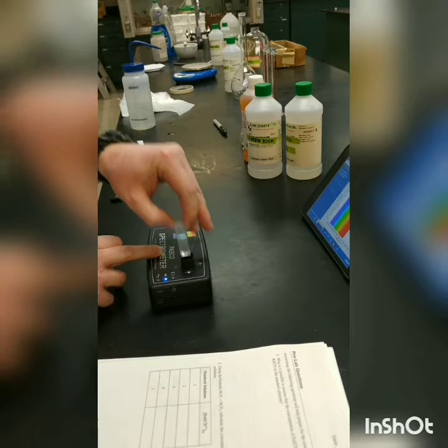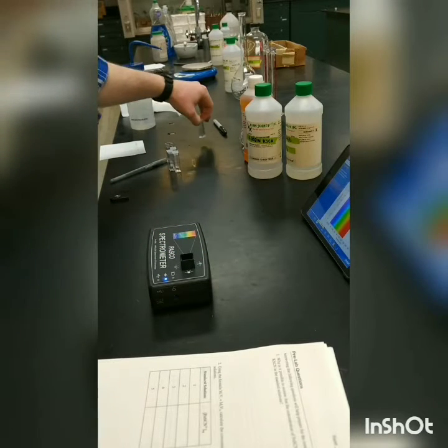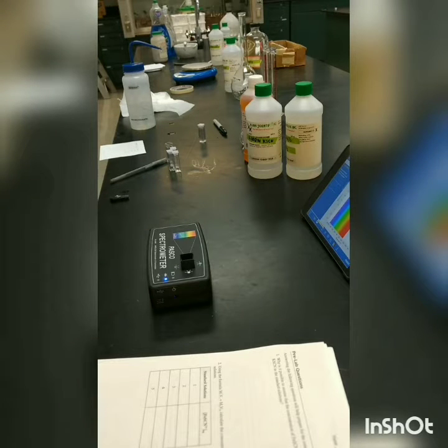So then the next thing we're going to do, on the instructions, it actually says to put in a wavelength of 450 nanometers. This machine will actually determine that wavelength automatically. So I'm not totally sure that it'll come up with 450 nanometers when we run it, but we'll find out here in a second.